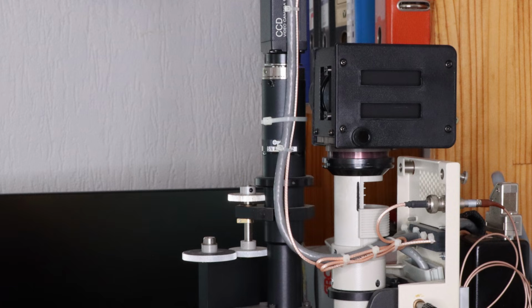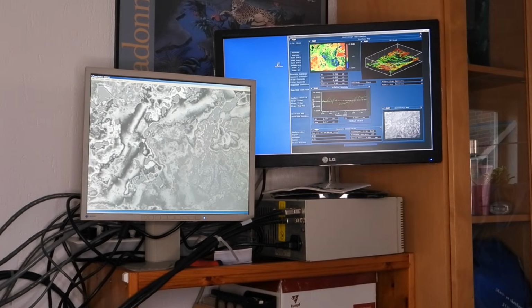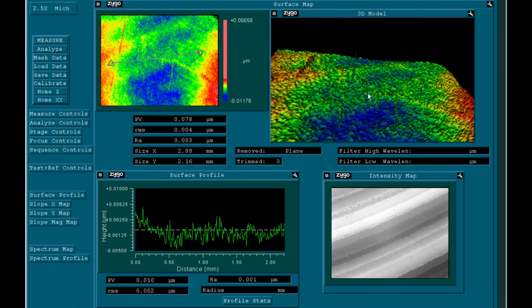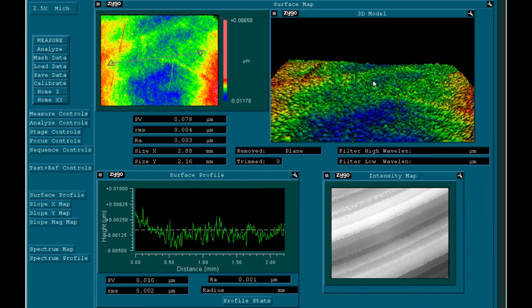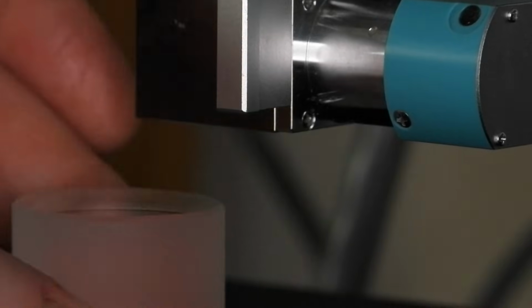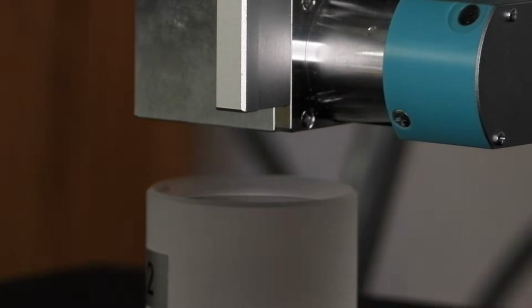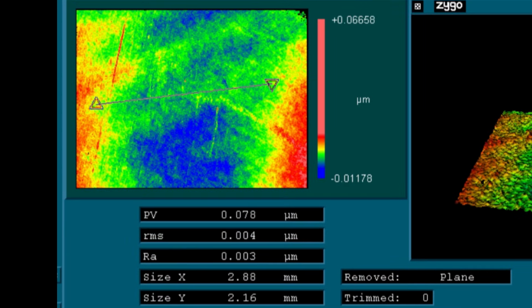And that's all basically. Now, the most complicated part of this instrument is probably the software, and I'm not going to discuss it here, it's really extensive. Instead, we'll just take a look at how it presents the results and evaluate a few measurements done with this instrument. Here is a measurement done on a flat piece of glass. We'll place this surface at the correct distance and angle and then perform a coherence scan. From the scan, the software then extracts the height data for every pixel, corrects it for a general difference in tilt, and then presents these data in different ways, for example in a contour map.